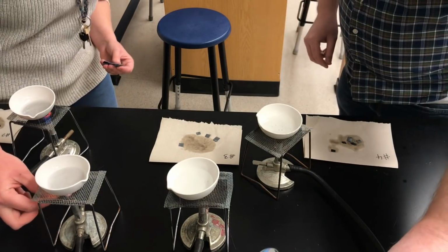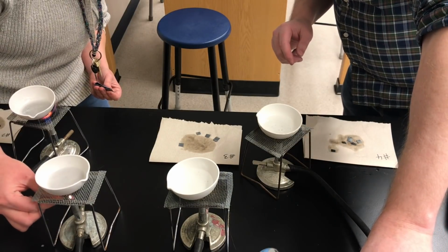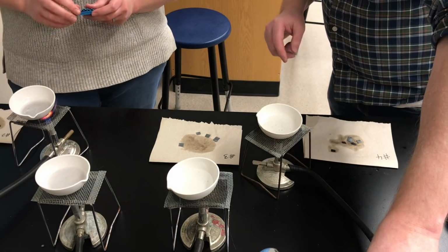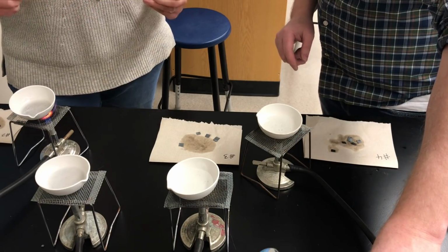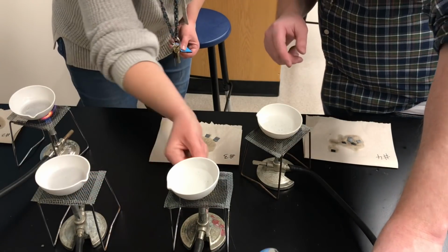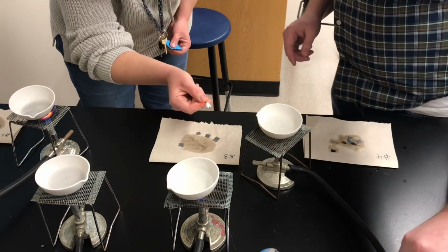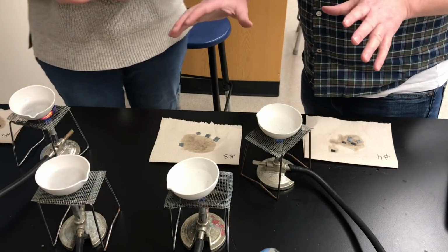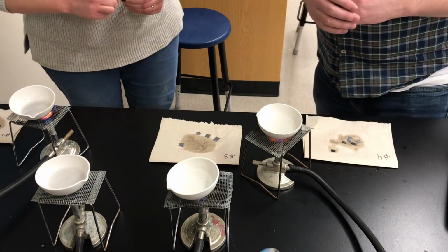And now, okay. That one's not wanting to light, but we'll just let it go for a moment. So we'll light another match. Give that a try. Nope. All right, so we got to get another burner, but let's get these guys lit as well. There you go. And this guy here as well. So now we're going to evaporate the solutions to dryness, and then we'll let them cool when they're done. And we'll show you what that looks like before we continue.